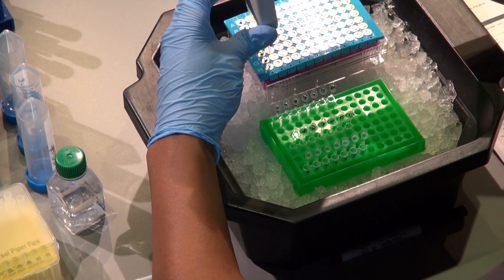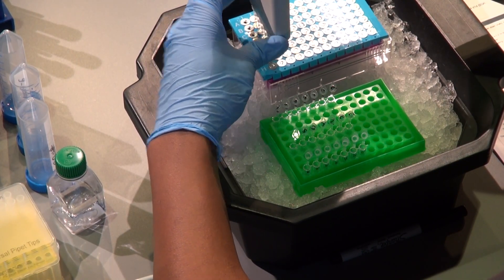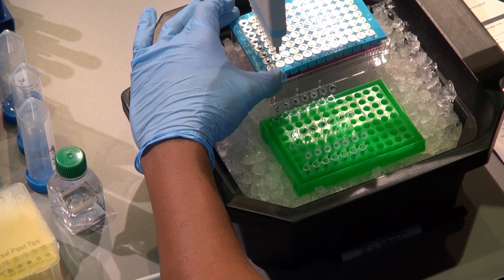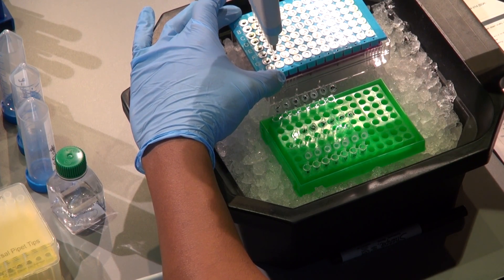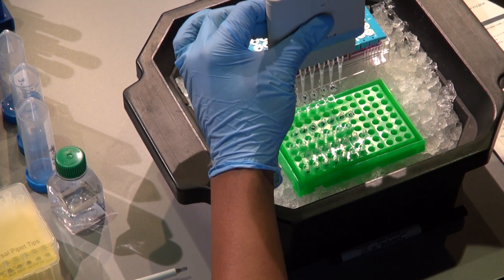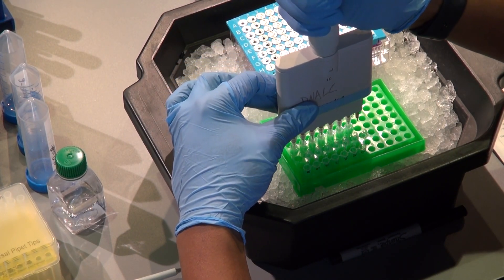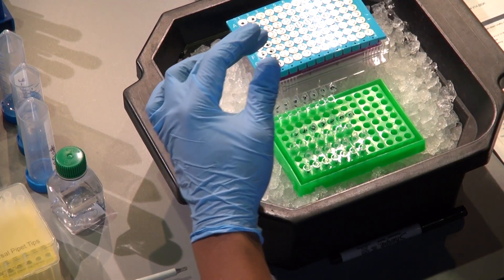You need to keep track of which barcodes you're using, and you can go ahead and directly puncture the foil. I press down and then draw it up, visually confirming I have that volume. I've got to make sure I keep my orientation correct so I know which barcodes are going in. The protocol mentions pipetting up and down — it says 10 times — to mix everything thoroughly.